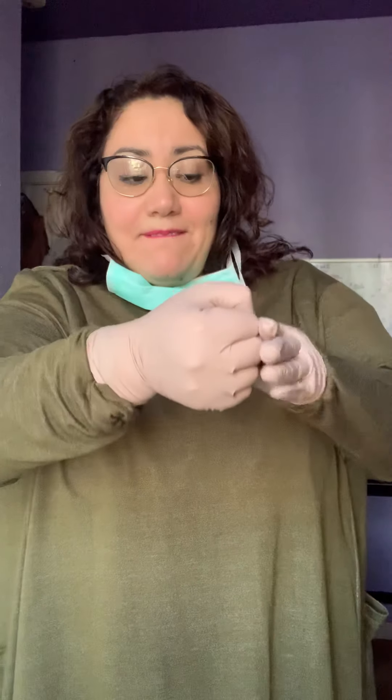I will make sure to start with my gloves. It's very important to remember that if it's something airborne, you have to wear the mask until you're outside of the room — the mask is the last thing that comes off. So we start with our gloves. The way you remove your gloves is just like this — you pull it off like that, make it into a little crumple from the inside without touching the outside. The gloves come off just like that, then you discard them.